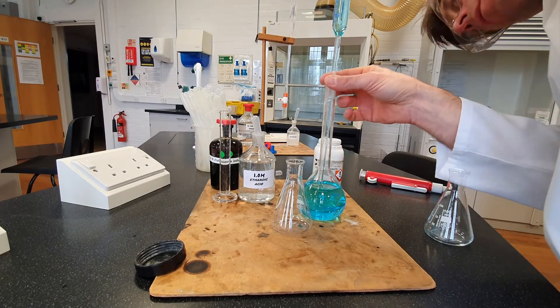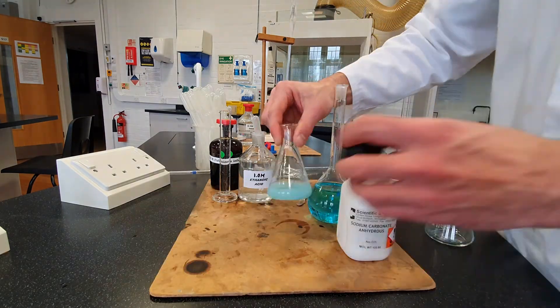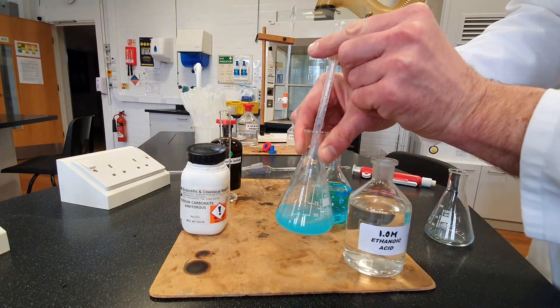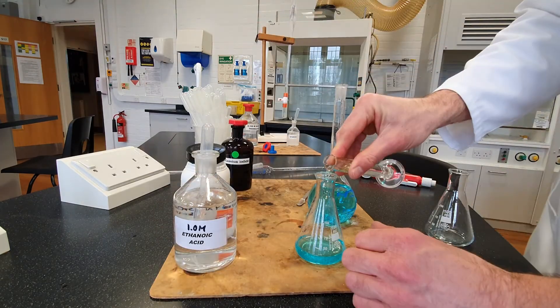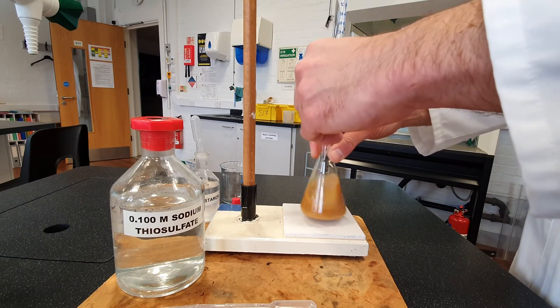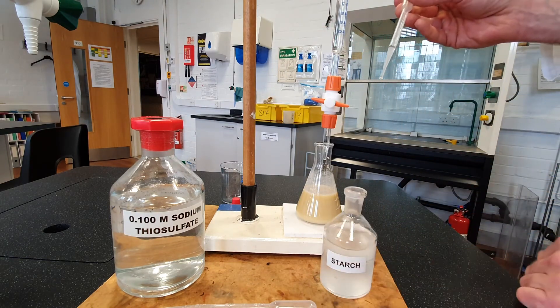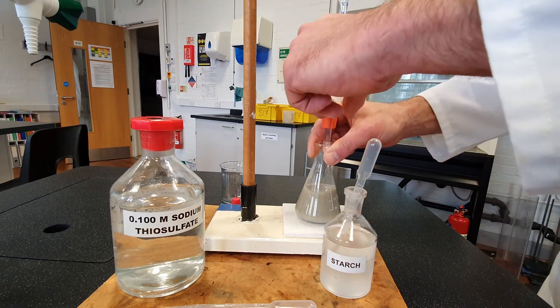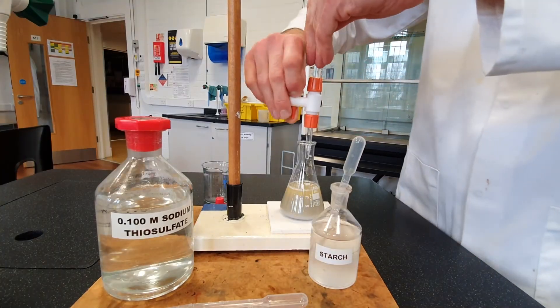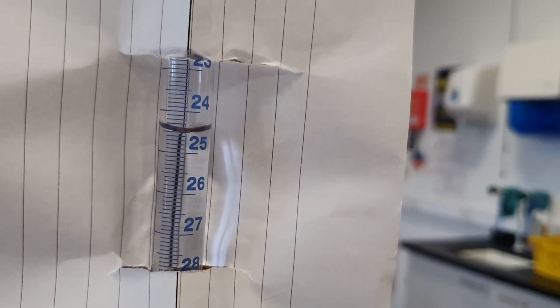Now prepare the solution for the next titration: 25 cm³ of the copper solution into a 100 cm³ conical flask. Add some sodium carbonate until a white precipitate forms. Add some ethanoic acid until the white precipitate just dissolves. Add some potassium iodide to liberate the iodine. For the second titration, look for the orange colour to go to a pale straw colour, then add some starch indicator to give a blue-black colour. It's quite a difficult end point to spot — wait for the white precipitate to appear, then take the burette reading.